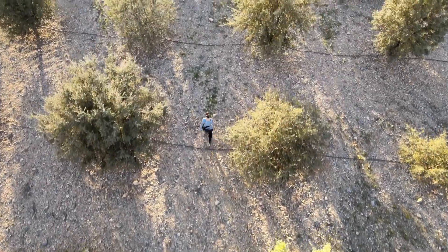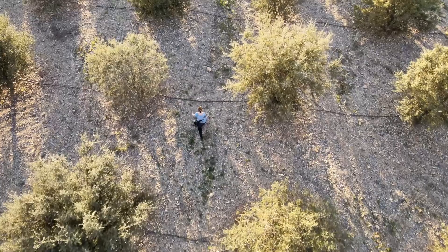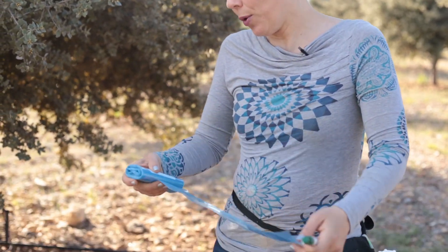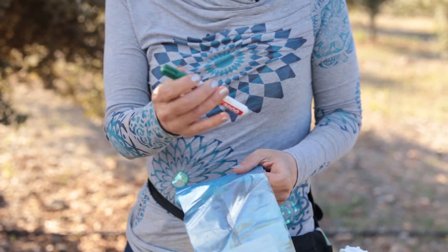Once that is done, you will come to the plantation to do what I'm going to show you now. The first thing we're going to do is label the bag and label the tree so that we can localize the tree with the sample. When we have the analysis results, we know which tree they correspond to, and we can see if we have to do some monitoring of that tree later, or if we know a tree is in trouble.